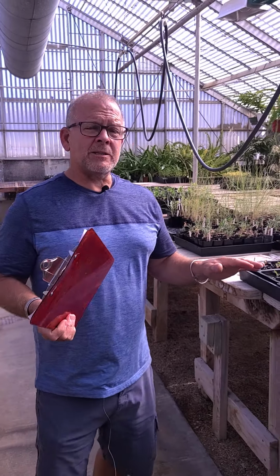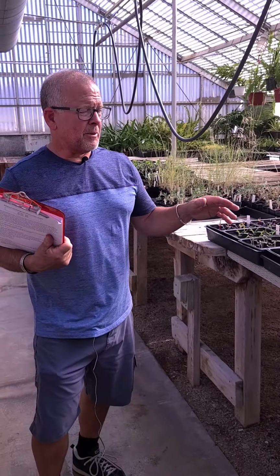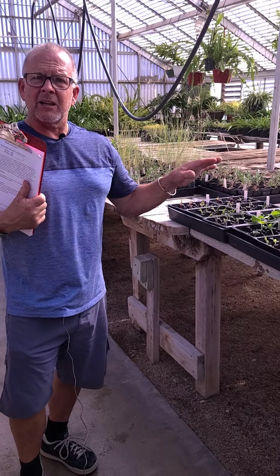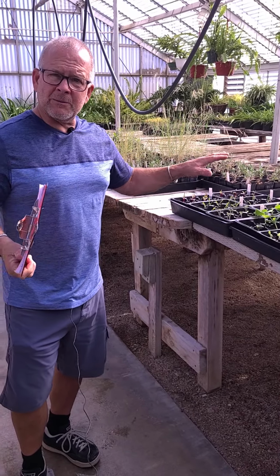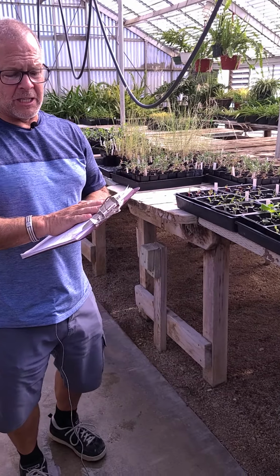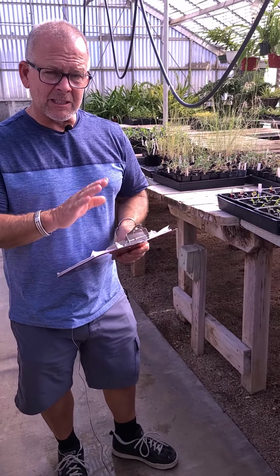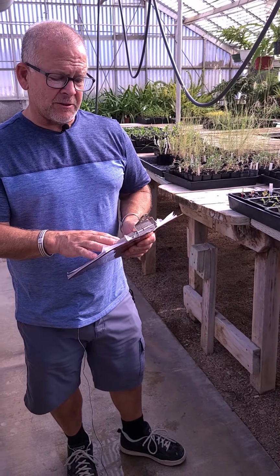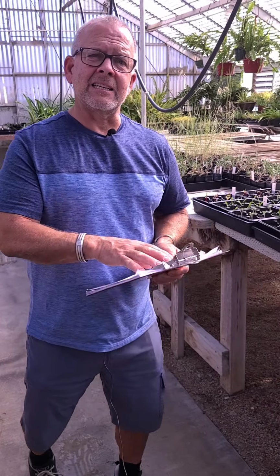I wanted to actually wait to do this lab and talk about it until we actually have something to show you. But we're almost ready here, and you'll see in a second, for us to go to the second part of that. So what I'm going to do is explain what's going on here and why we have all these plants. But to make sure you understand it, I'm just going to go ahead and read off the handout that you guys will have available to you. So this is Lab 4, and it's effects of soil drainage and salinity on plant growth.